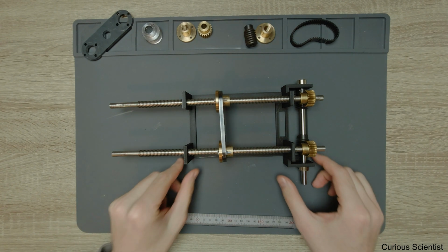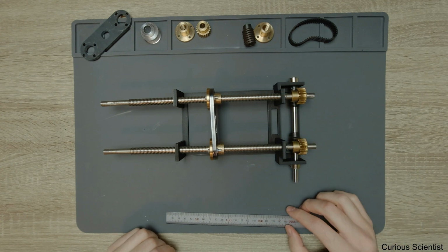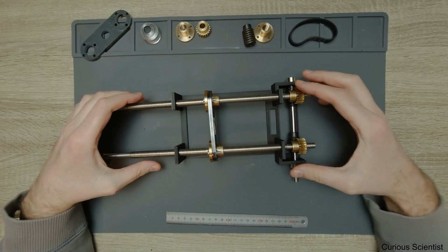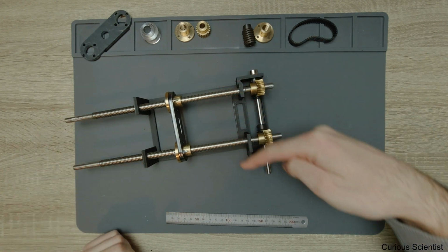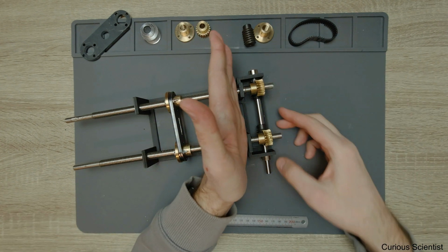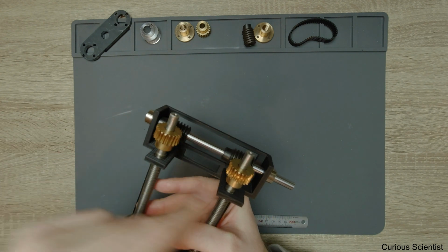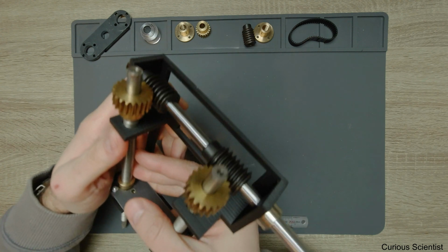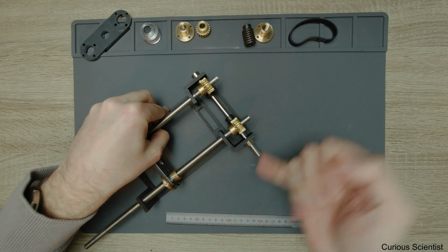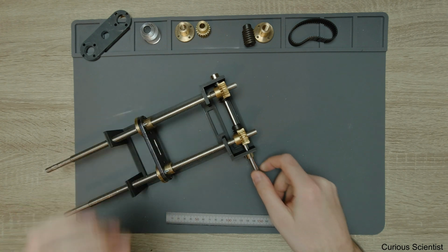But the most important thing is that I made and printed this because I wanted to check the dimensions before I prepare this structure, especially this part here, out of metal. So actually this part, which connects the lead screw and the worm wheel and the worm gear together, and the shaft as well, this will be made out of metal.